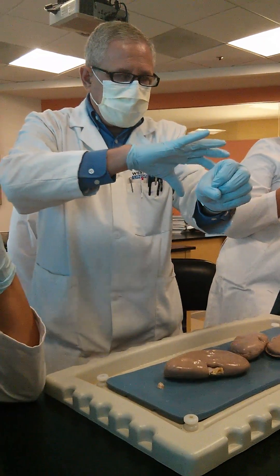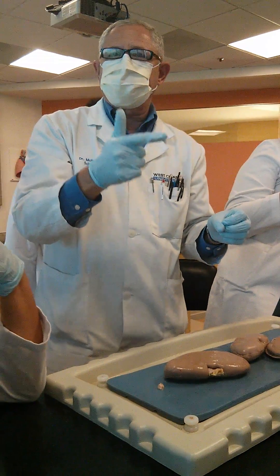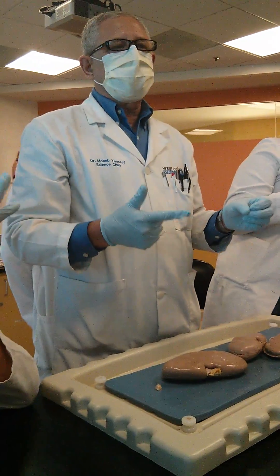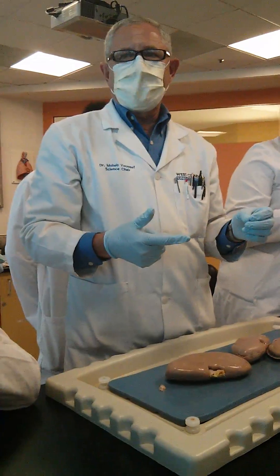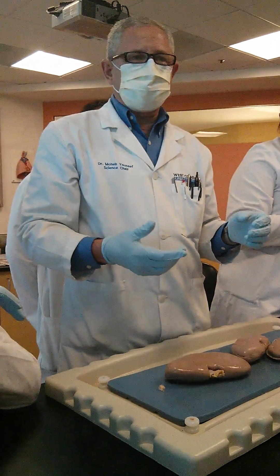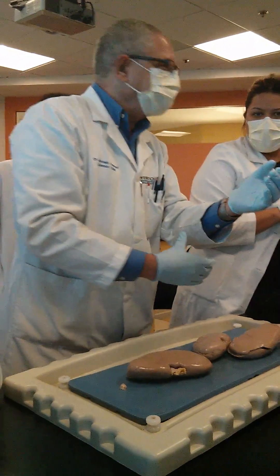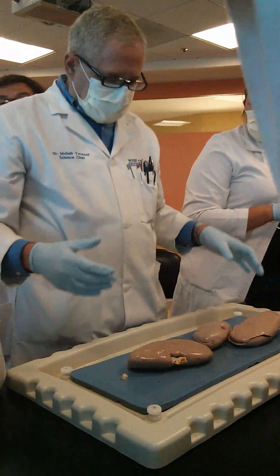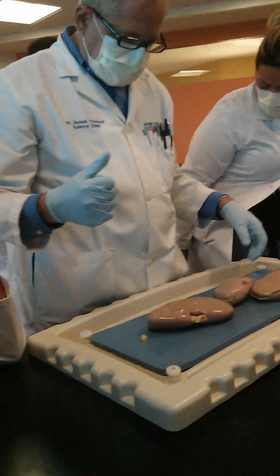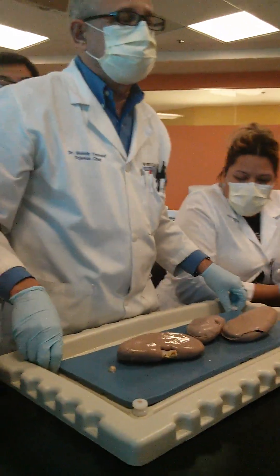When organs migrated, they took a sleeve that contains the artery, the vein, and everything needed for nutrition. This is called the mesentery. Now I know you're going to ask what the mesentery is — I'm not going to show it right now.